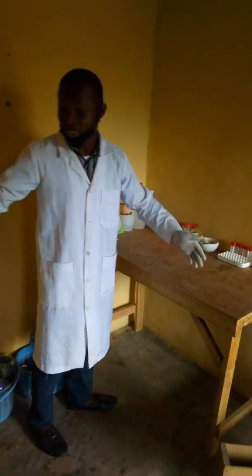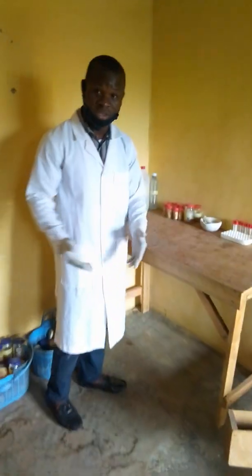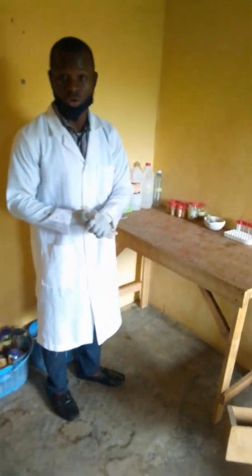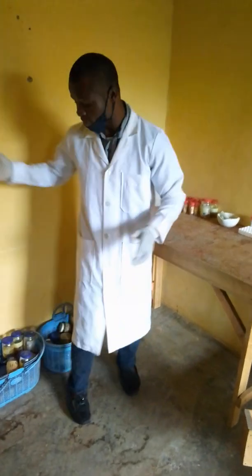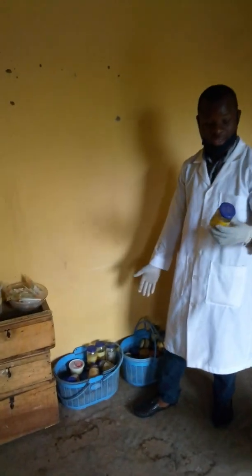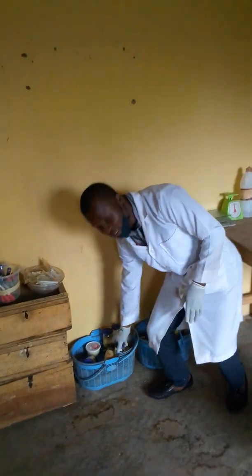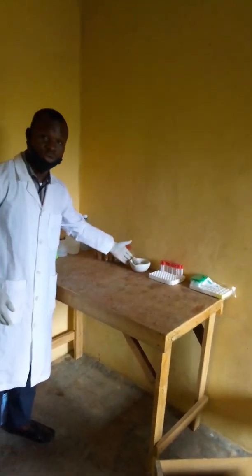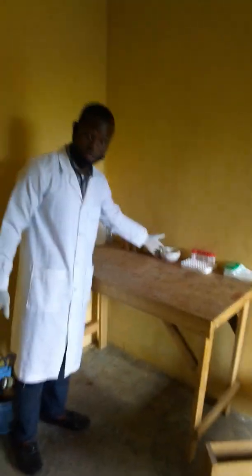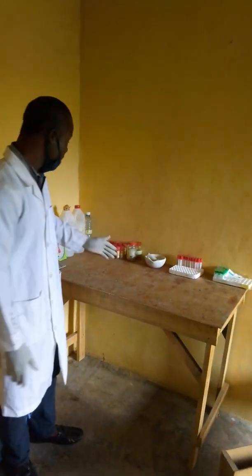Having harvested the brain, because after the experimental period we tend to sacrifice the animal, then we harvest the brain of the animal, then we fix it in formalin fixative, just like we have some here in the basket. We have some harvested brain in the fixative for a period of time. Then after that, those that will undergo tissue homogenization, we don't put them in formalin. Are you getting the gist now? So we homogenize those ones freshly as removed from the sacrificed animal.